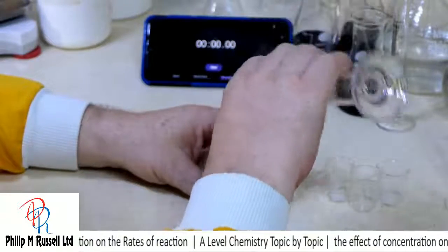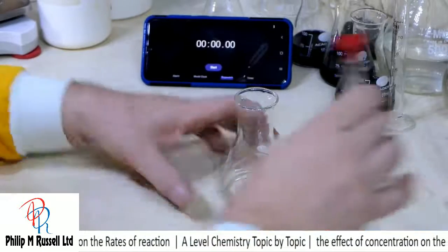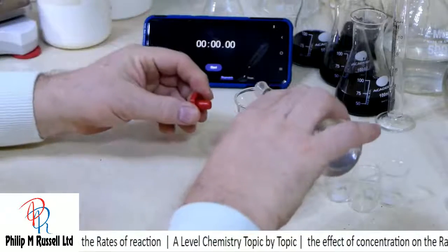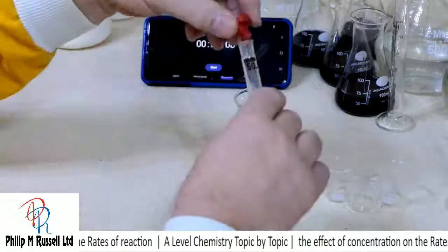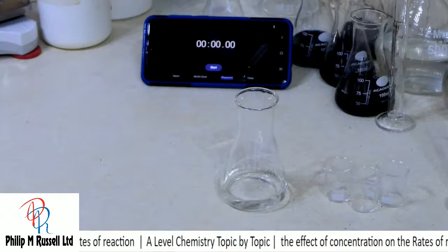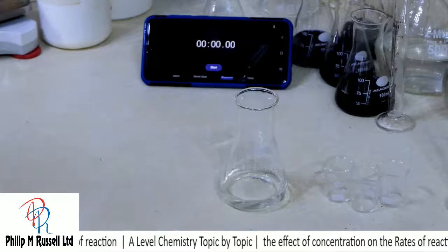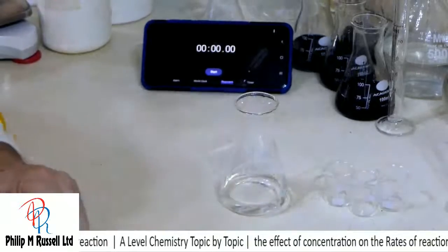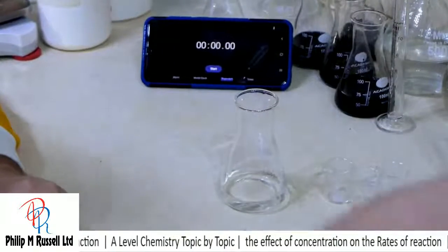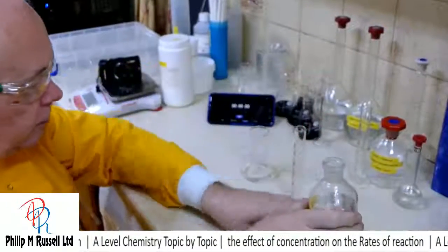So I've got my water. I'm going to put in just a little bit of starch indicator, and now we want to play with the other stuff. So let's now get some potassium iodate, and we're going to use 10 mils of this.